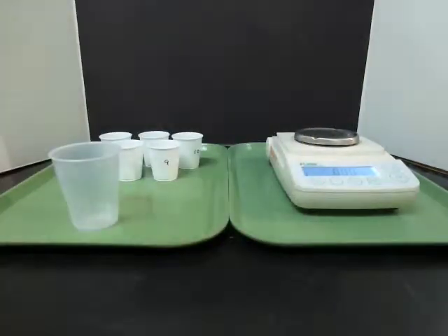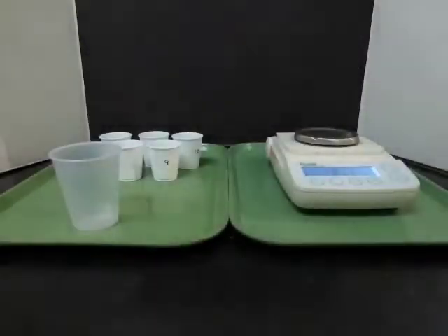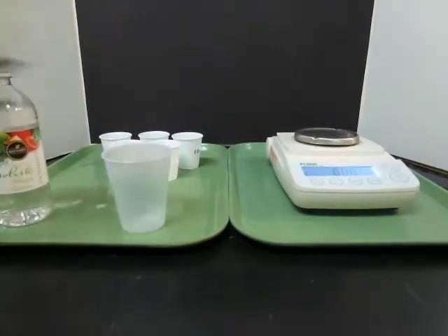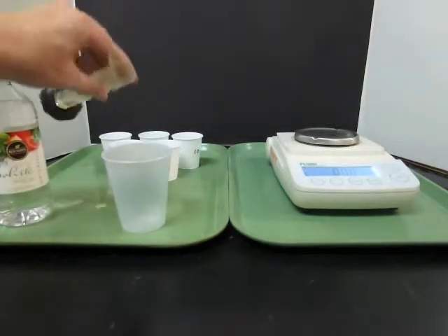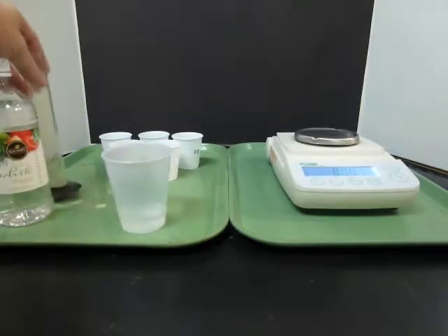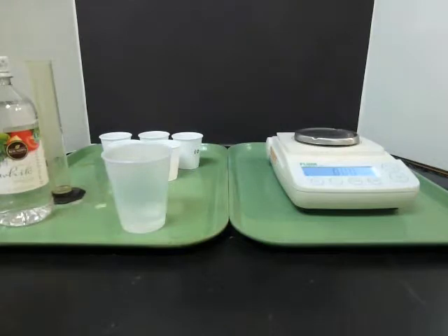When you go back to the lab bench, make sure that you're following the procedures. You won't need any goggles today, but begin by choosing a cup and use the vinegar and a graduated cylinder to put 30 milliliters of vinegar into a cup. Each person can do this experiment on your own. There's plenty of materials for everyone to give it a try.